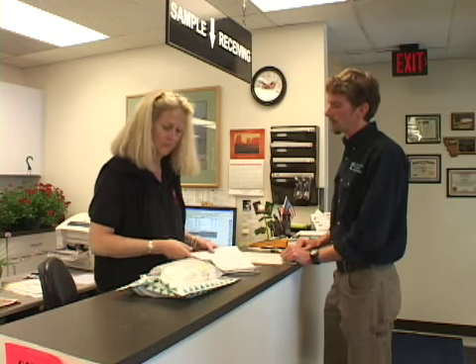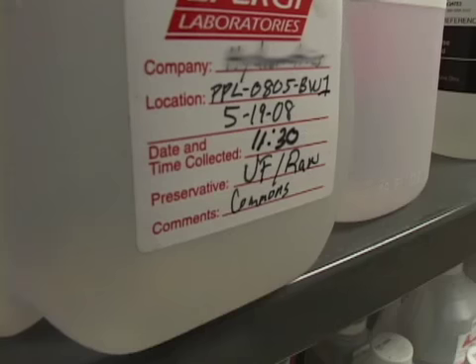Great, thank you. Well, let's go back and take a look at what happens after the samples reach the lab. Hi, Adam. I'm Wynn. How can I help you? Well, I just dropped off 2 samples at the front desk for a full domestic analysis on my well, and I'm interested in what happens to the samples now.